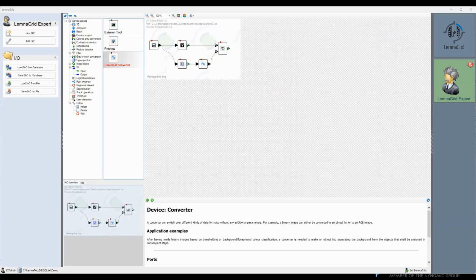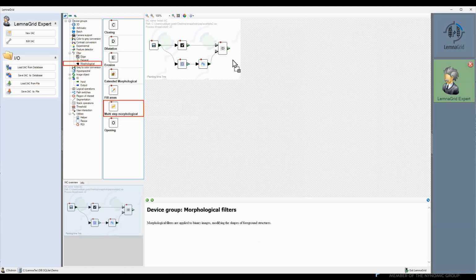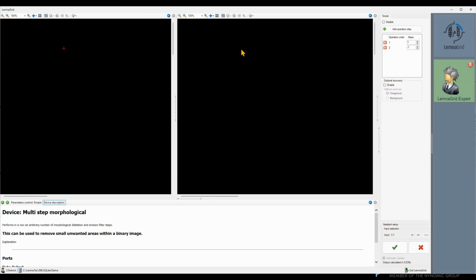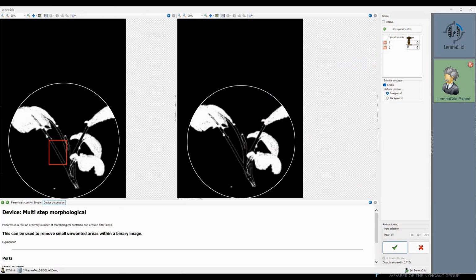Now we need some further cleaning and smoothing of the binary mask. We add a multi-step morphology and enable subpixel accuracy. Enabling subpixel accuracy helps preserving the shape, but will need a bit higher morphological steps in exchange. First, we want to get rid of the contours of the stem. This contour is a 1 pixel wide line for the most part. Therefore, we use a 2 subpixel erosion.